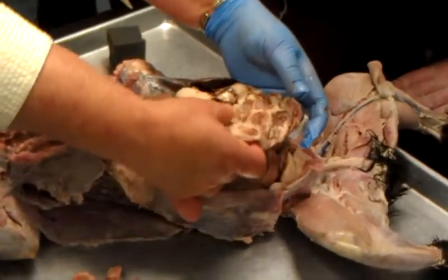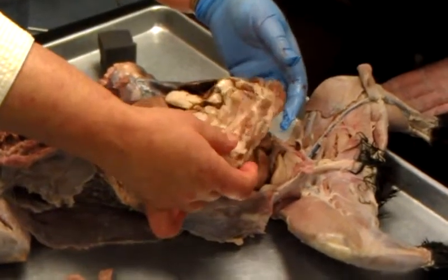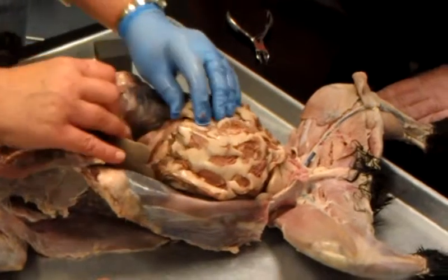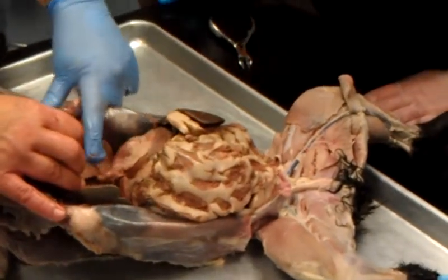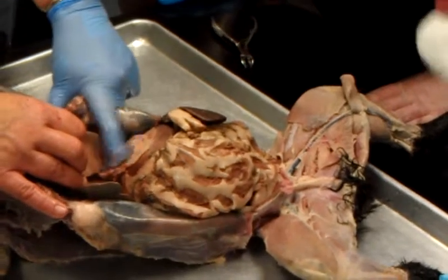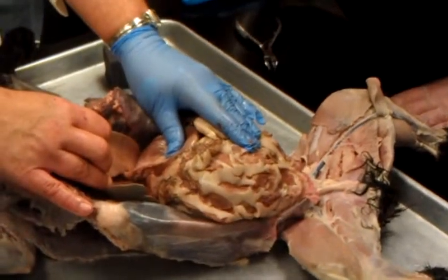And these things that look like fat in here, these are the omental bursa. This is all on my sheet. Where's the lesser omentum? The lesser omentum is this little piece that goes from the stomach up. See it right here? So this is the greater omentum. This is the what? Lesser.